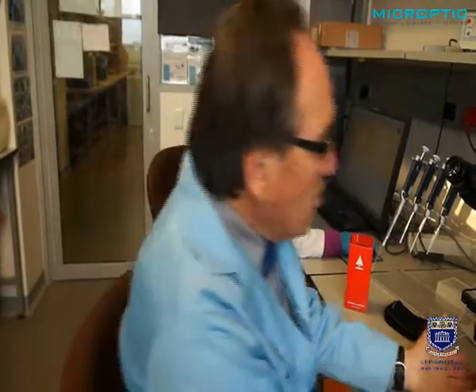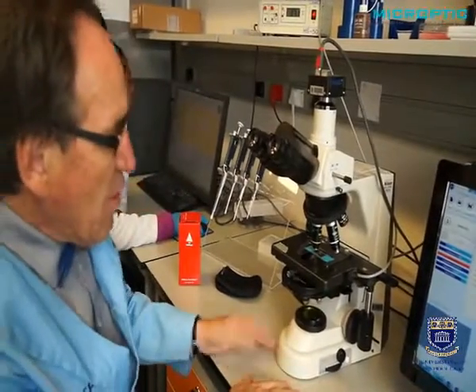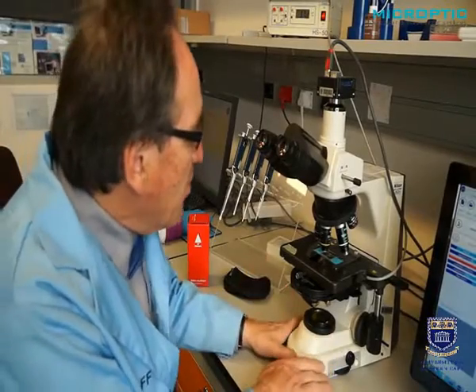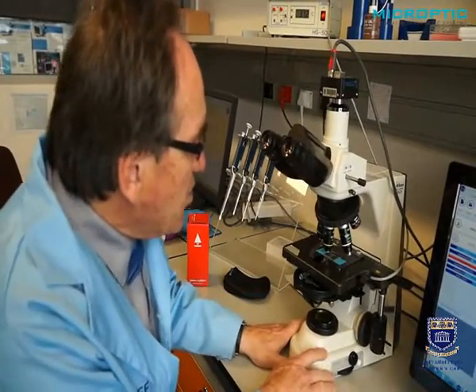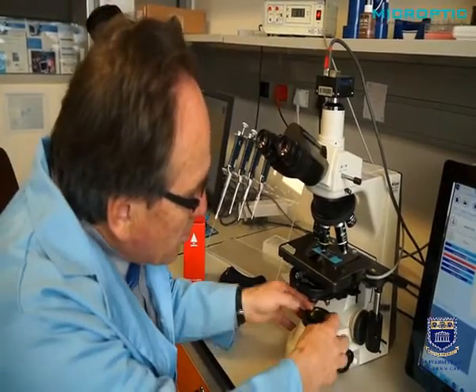Okay, now that I've shown you the basic requirements for a CASA laboratory, which is indeed very simple, but one must be very thorough about it, we can go into the details of specifically computer-aided semen analysis. And let's start off with the details of the microscope. So we're going to concentrate here on all the components that are required really. So one needs a really good, solid compound microscope. In this instance, I'm using a Nikon E50i microscope, and it is fitted with, first of all, a very good halogen source.